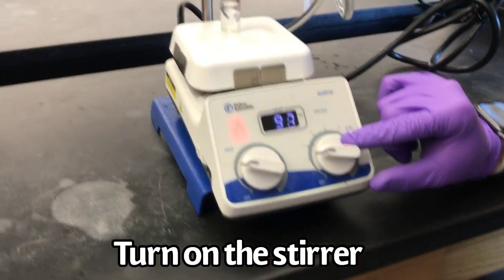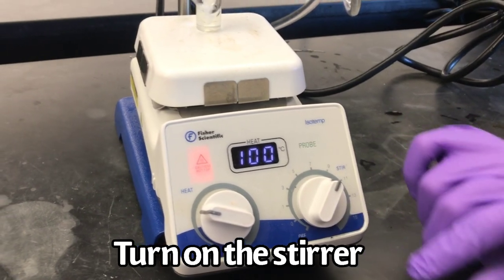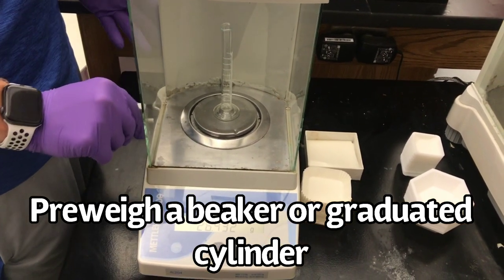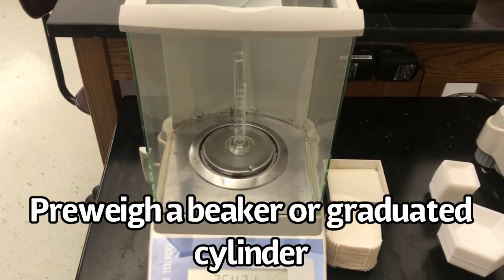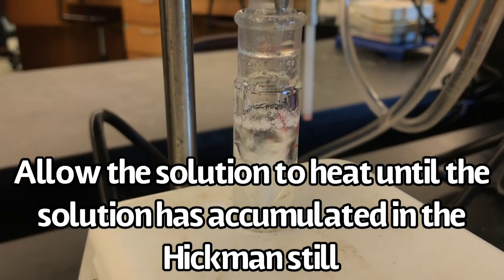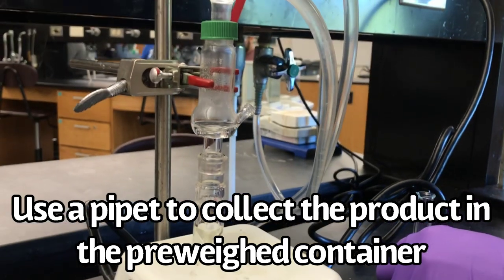Turn on the stirrer. Pre-weigh a beaker or a graduated cylinder. Allow the solution to heat until the product has accumulated in the Hickman still. Use a pipette to collect the product in your pre-weighed container.